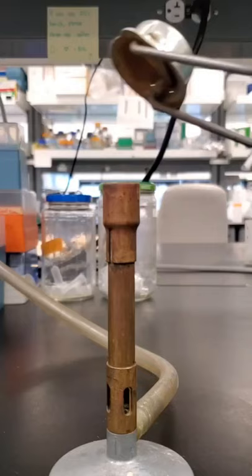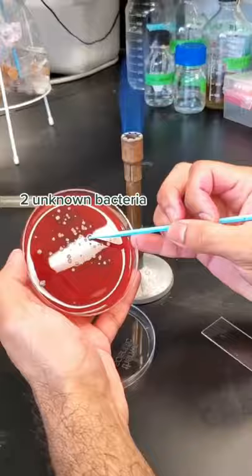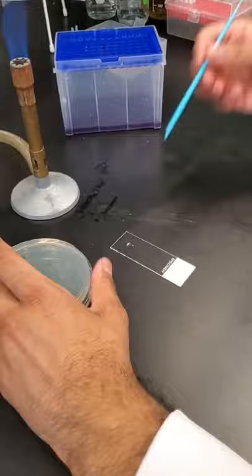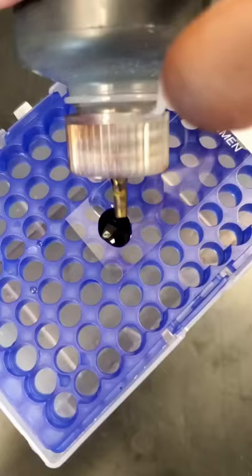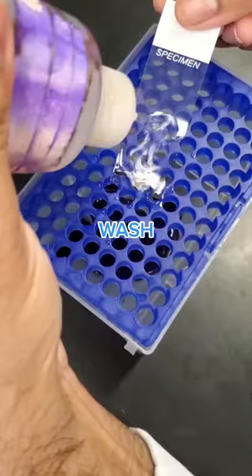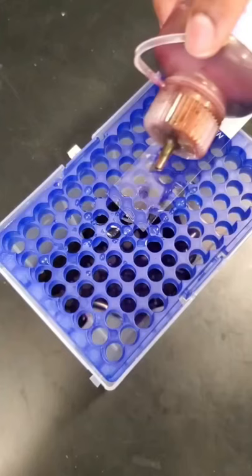Working under a flame, I took isolates of bacteria from a plate I coughed on and put it into a drop of water on a glass slide. I repeated this with an isolate which I knew was E. coli. Crystal violet, the first stain, binds peptidoglycan in the cell wall. Next, iodine is added to form a complex with crystal violet. Ethanol is used to decolorize, washing away crystal violet from only gram-negative bacteria, which we then counterstain to give a red color.